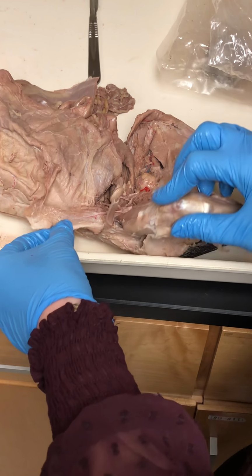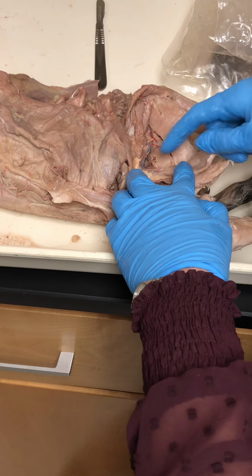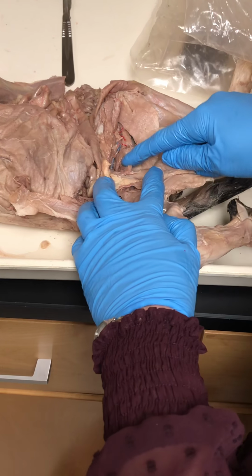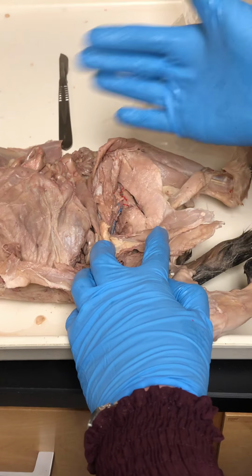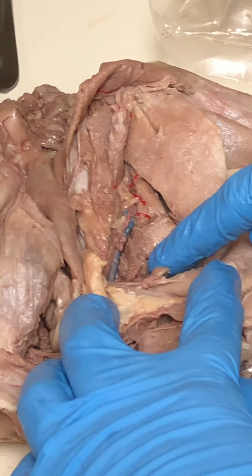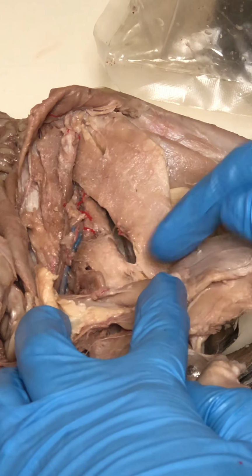Adductor longus. Okay, we're going to skip adductor longus. We can't see it well in this dissected cat. Adductor magnus. So adductor magnus is here. Adductor longus would be up even closer to the groin. An adductor muscle is going to adduct the hip, so pull the thigh inwards. So here is your adductor magnus. The longus would be above that, but we can't see it well. So here's the adductor magnus. Okay?